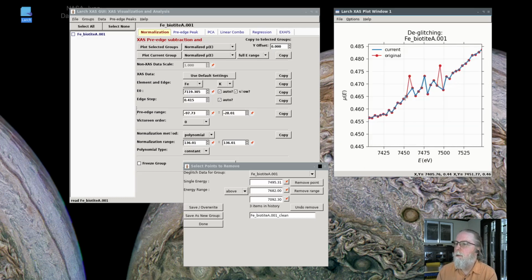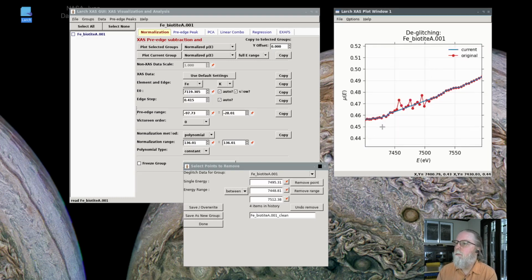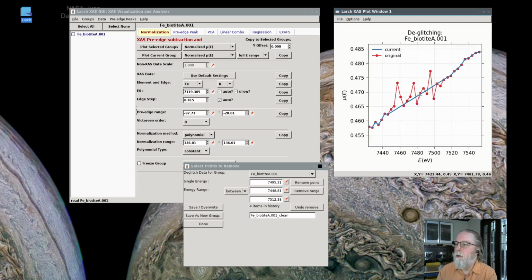But also, I think we want to remove that data in the glitch region, and to do that, again, I'm just zooming in, and we can say between 2 energy points. So I'll say this point here as the low end, and then this point up here as the high end, and say let's remove all the points in between there. And you can see those are gone, and it hasn't filled them in with other data, it's just removed them.